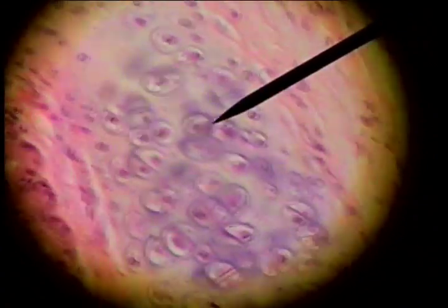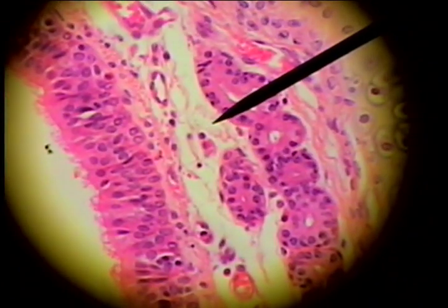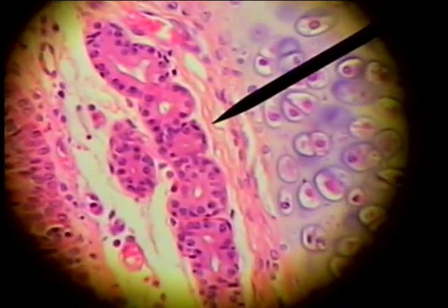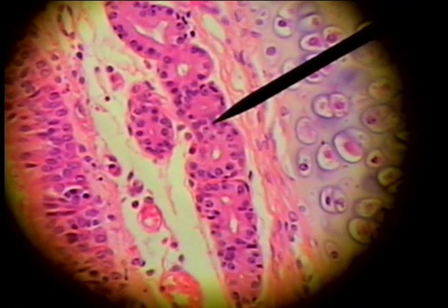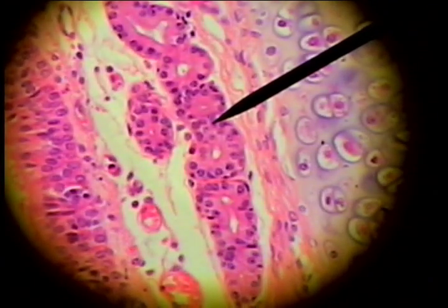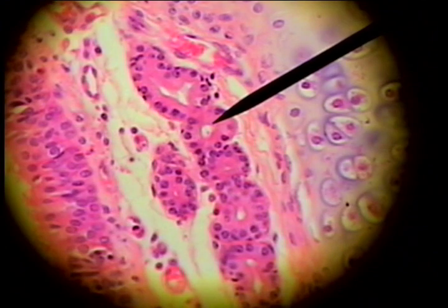Also, if we look in the connective tissue beneath the epithelium, we see glands. These would be mucus glands that are made up of cuboidal epithelium and keep the trachea surface moist.